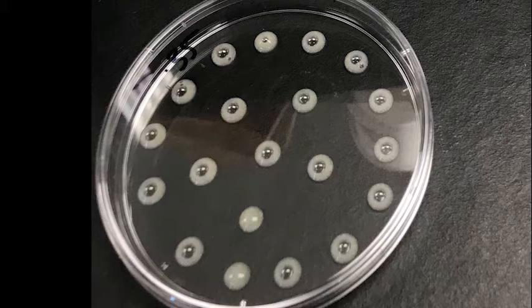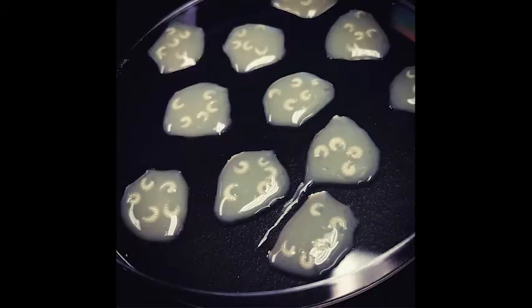Again, another example showing what they look like. They'll consume that entire blob of food in about a day, and we've calibrated how much food we put in to match that. This is what it looks like if you wait until they consume all the food. They are just laying there on the clean dish. You can see some residual food where some of them have not eaten it all.